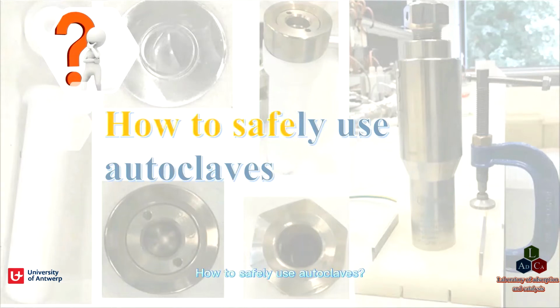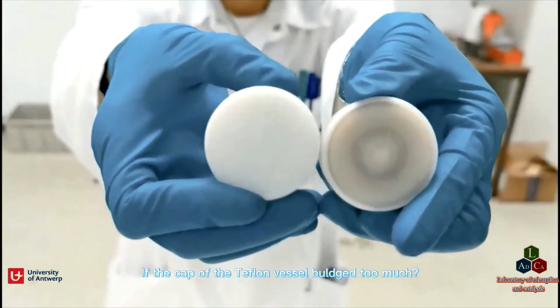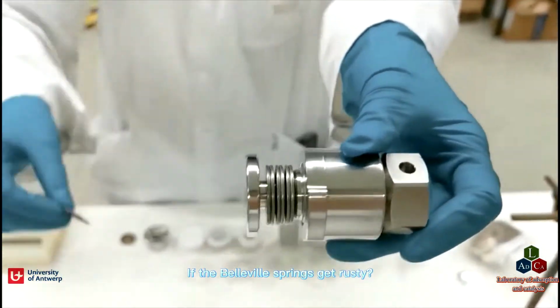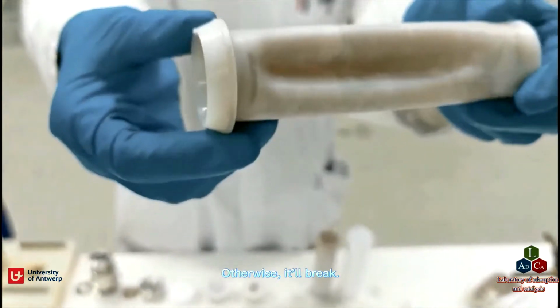How to safely use an autoclave? Before using, we first need to check if the autoclave is in good condition. Check if the Teflon vessel is aged, if the cap of the Teflon vessel is bulged too much, if the rupture disc is broken, or if the Belleville springs has gotten rusty. If one of these happens, please replace it with a new one, otherwise it will break.